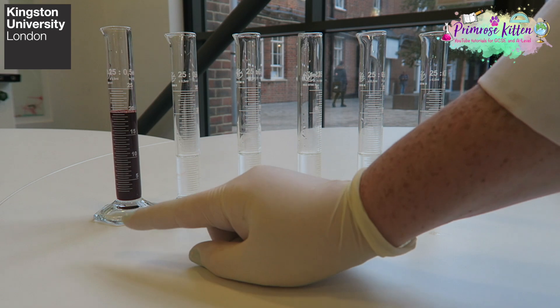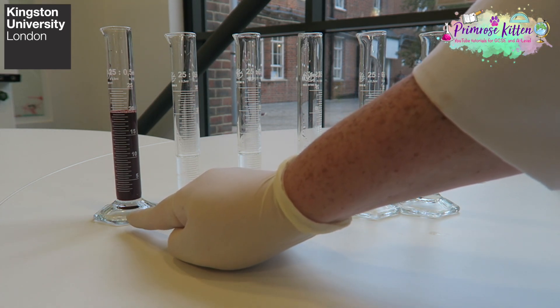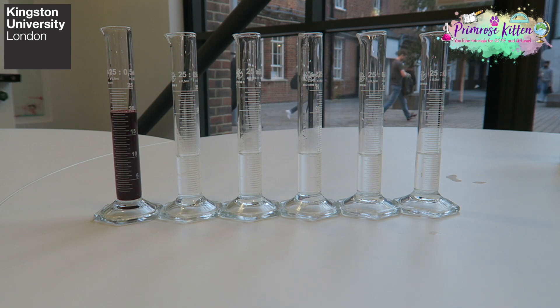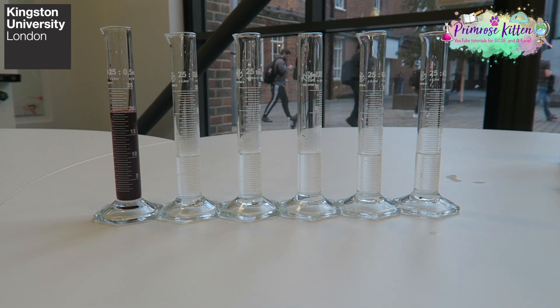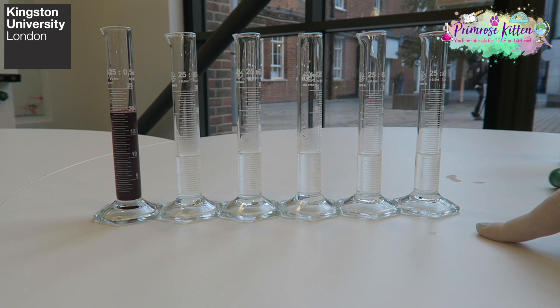Here I'm doing a very bad thing. I've put food coloring in a solution. I hate it when people do this, but this is a really good way of showing color to you. So I'm going to do a serial dilution down from here. This is a skill you need for biology and for chemistry. And the only reason I'm using red food coloring is so you can see the colors.